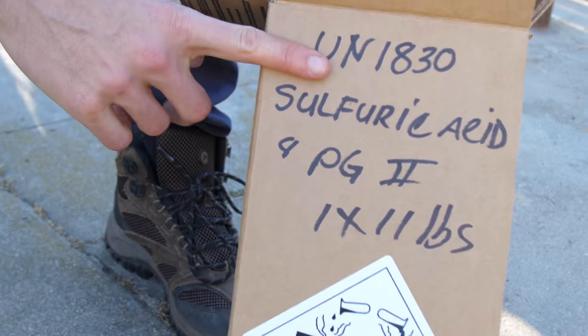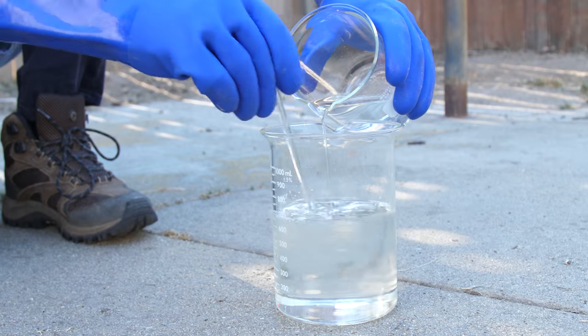Here's how we're going to do it: we're going to take high-powered hydrogen peroxide and high-powered sulfuric acid, mix them together in a solution called piranha solution, and we're going to see how well we can dissolve this fruitcake in this very aggressive solution. Alright, let's dissolve this fruitcake!